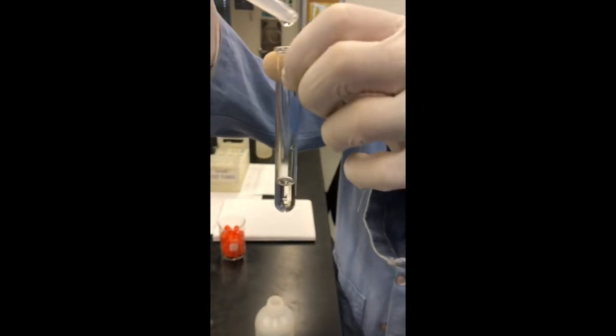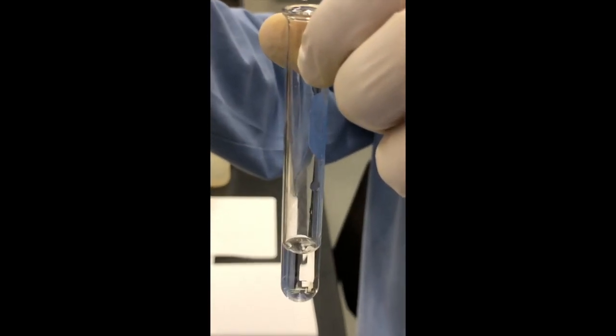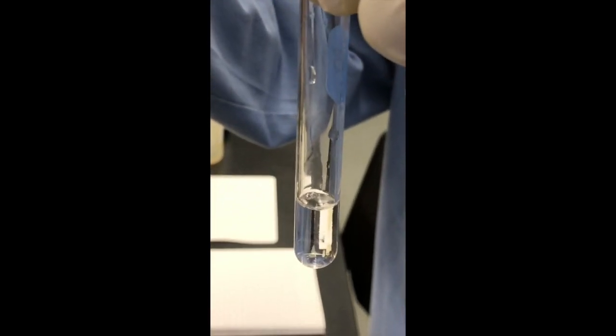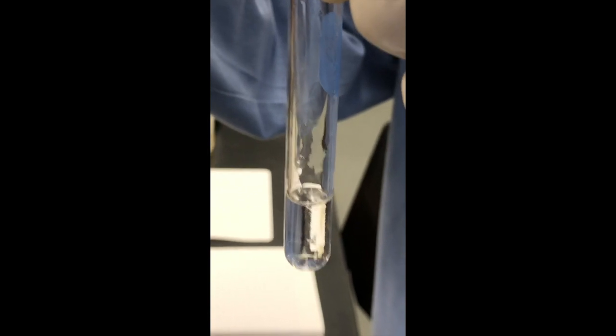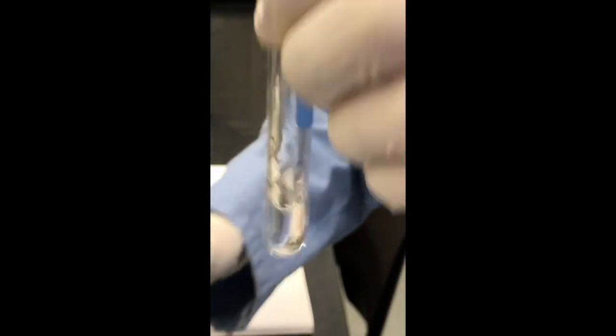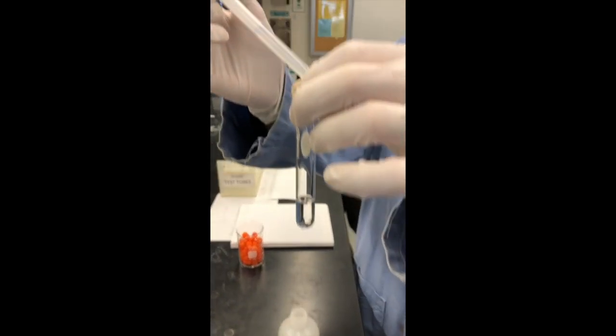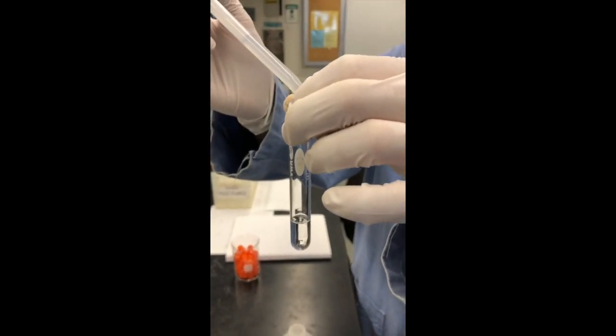Next, magnesium ion. Magnesium ion with sulfuric acid. After sulfuric acid comes sodium carbonate. You'll want to watch this next one very carefully to see what happens when the sodium carbonate solution hits the magnesium ion.